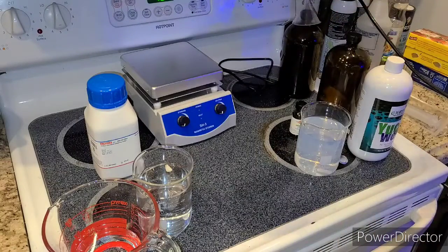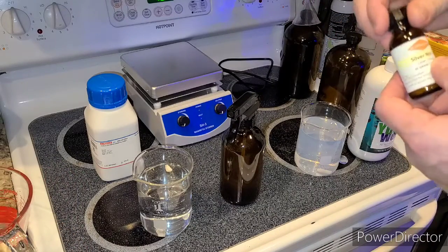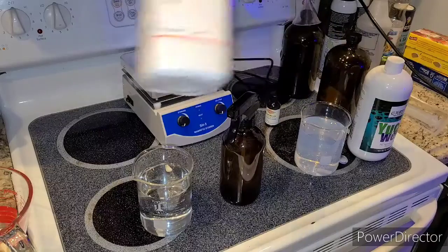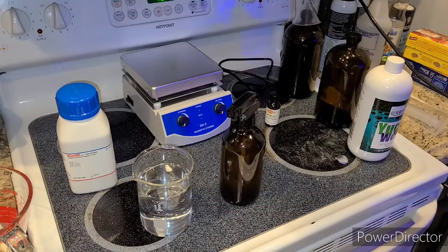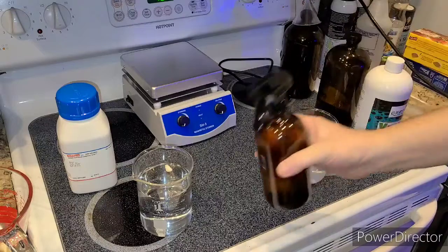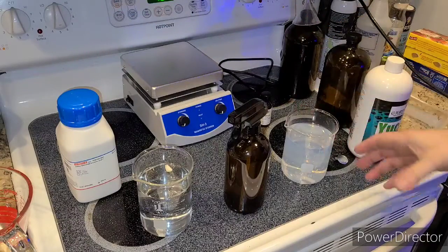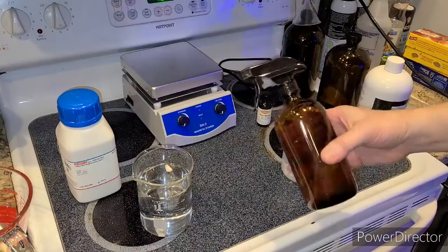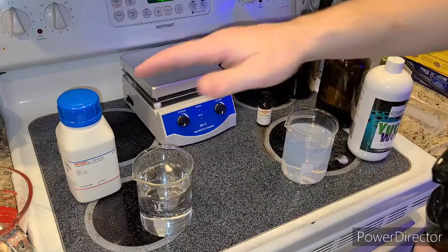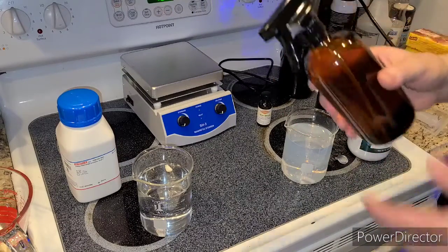It's super simple to make — that's 16 ounces right there. As you can see, I used barely any of these ingredients. This is 25 grams of silver nitrate and I used half a gram to make all this. I used 2.5 grams of sodium thiosulfate to make all this. Of that 500-milliliter base solution I only used 23 milliliters of each to make a 16-ounce bottle. So the point is, with this much silver nitrate and sodium thiosulfate, you can make gallons of this stuff.